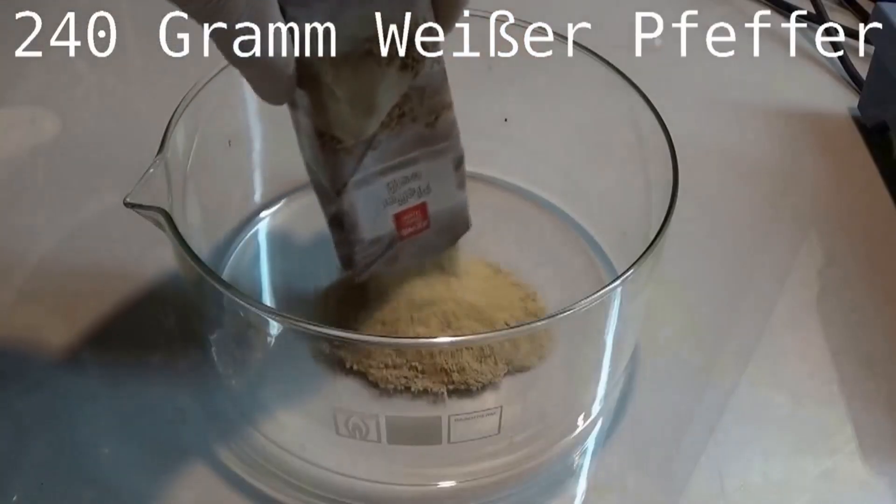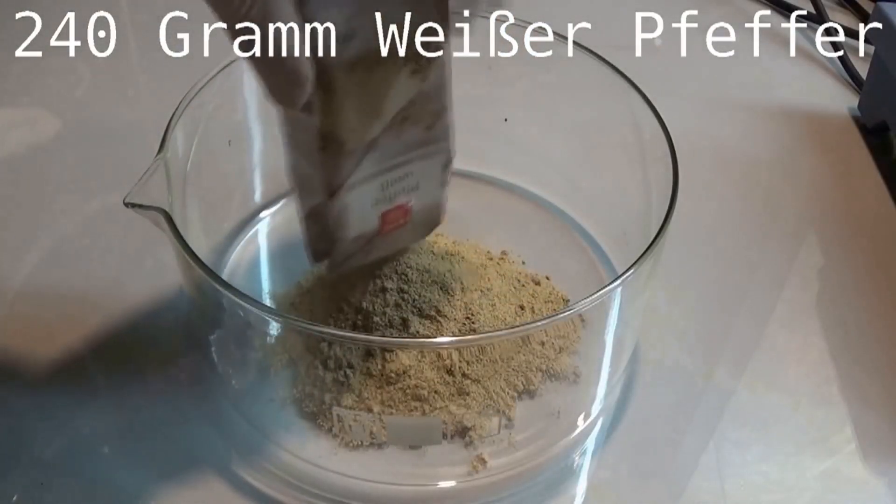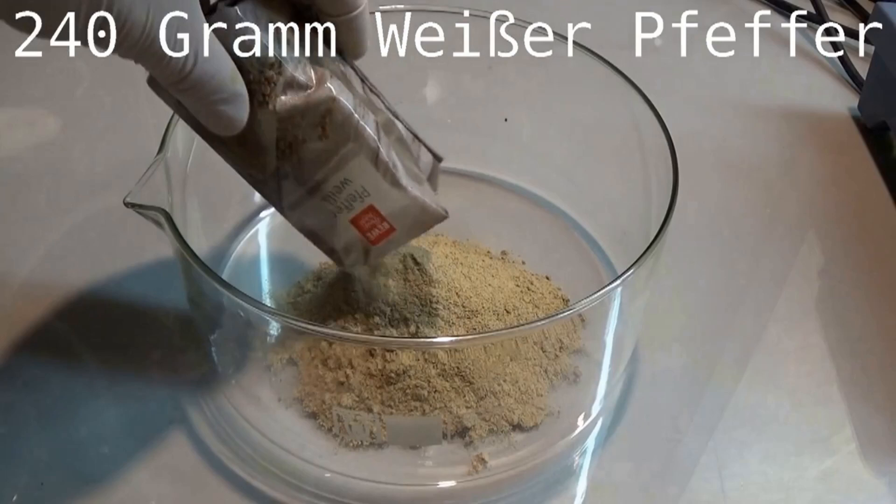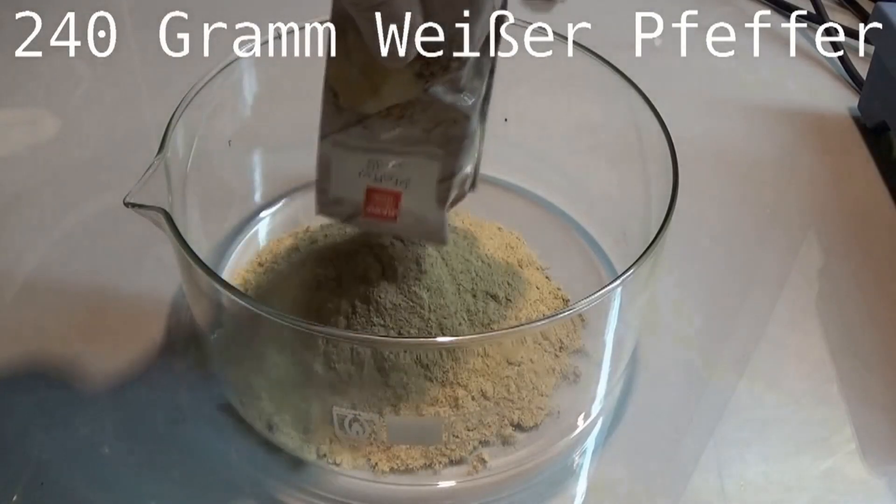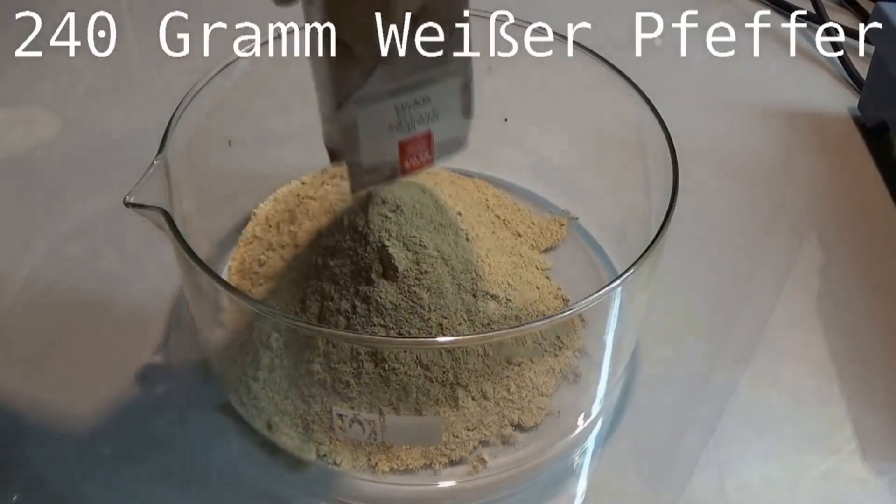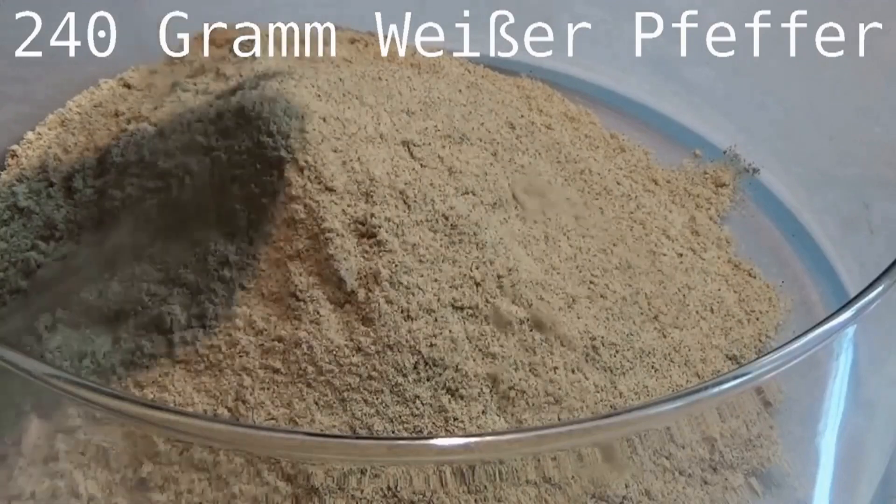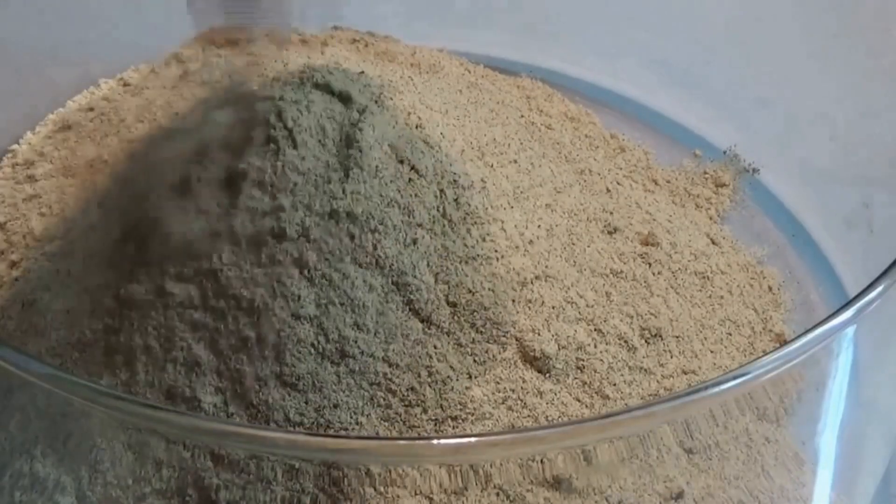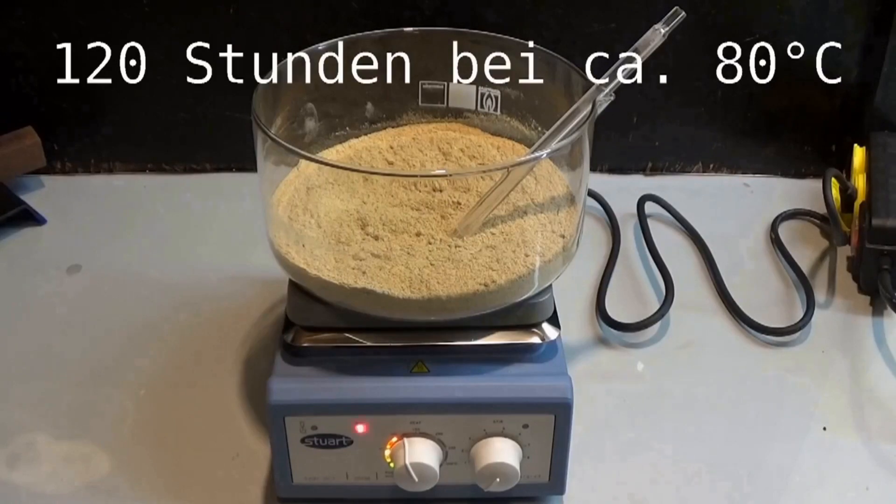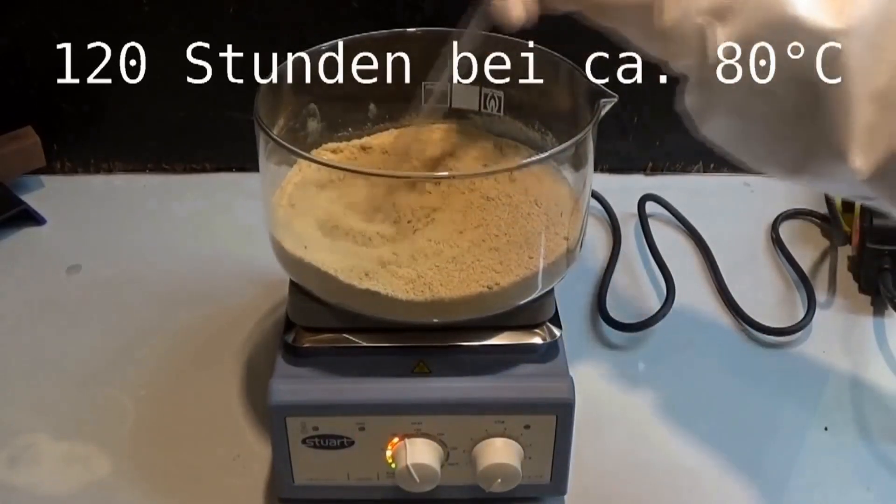Piperine is soluble in lipophilic solvents. To reduce the amount of water present in the pepper, I dried 240 grams over the course of around 120 hours at a temperature of 80 degrees Celsius. This all happened under the exclusion of light, which was achieved by wrapping everything in aluminum foil.